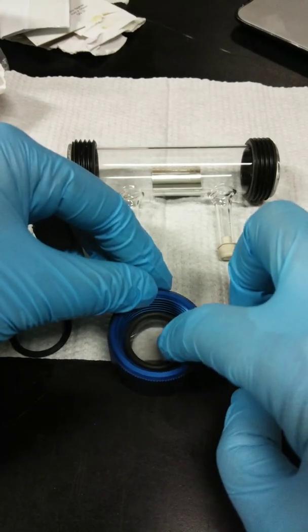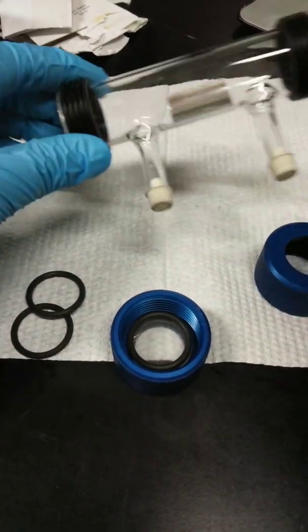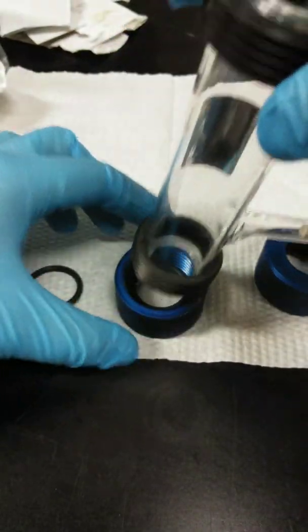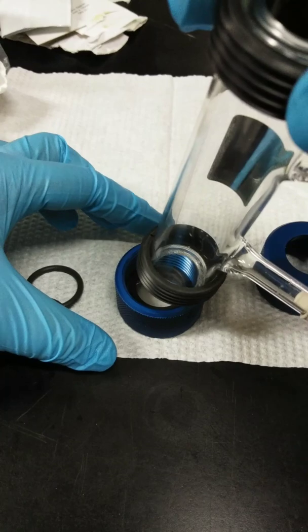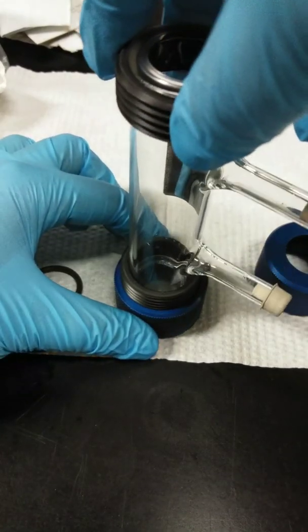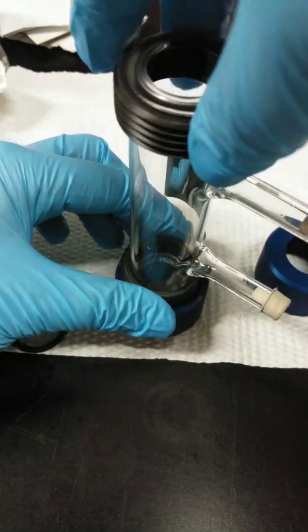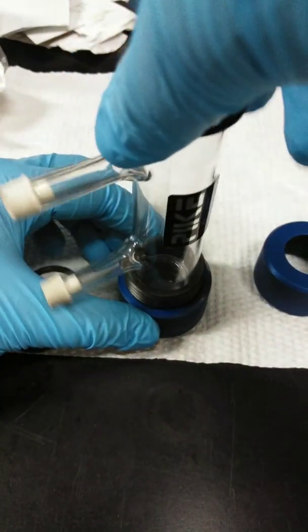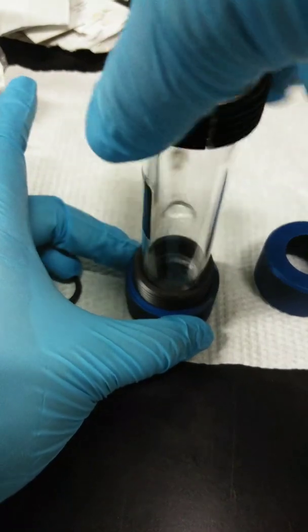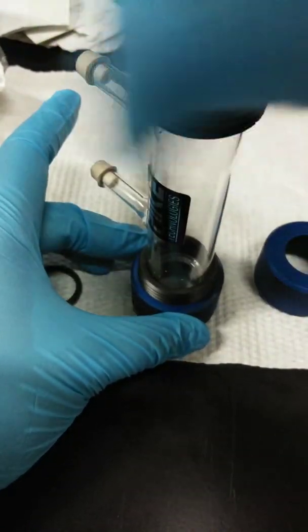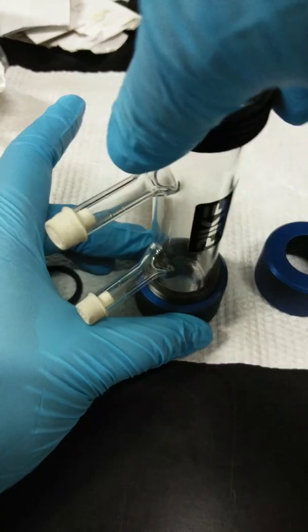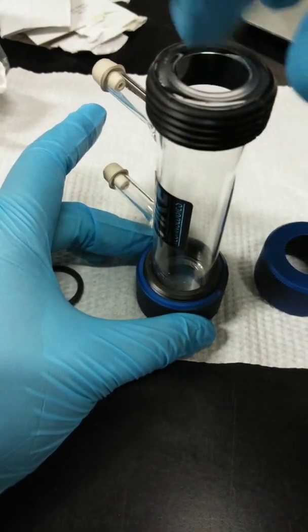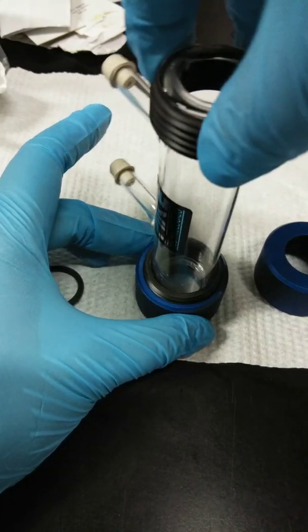And then place the second O-ring on top of it. So this is just to ensure or protect your plate so it won't break when you screw this up. So screw this up. When you screw this cell body over here. So you have to insert it and turn it until the threads engage. So be careful because it might fall over. So rotate. Rotate again. Now you can rotate. So you will see. So don't rotate it too much because the gas cell might break.